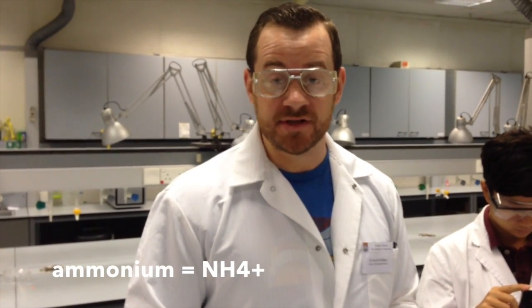Ammonium is a dissolved form of nitrogen that is common in marine and fresh waters, and it has a big impact on ecosystem productivity. In order to measure ammonium, we have to do some chemistry to exert a color change in a solution that can be detected by the spectrophotometer. That color change is going to be proportional to the concentration in our sample.